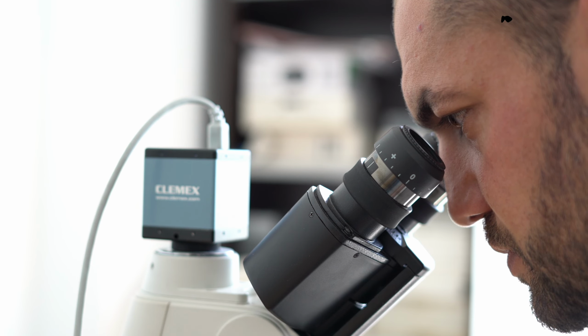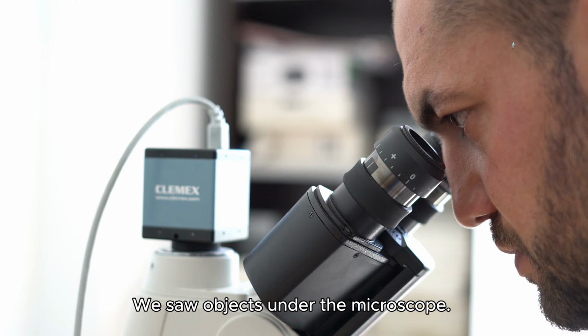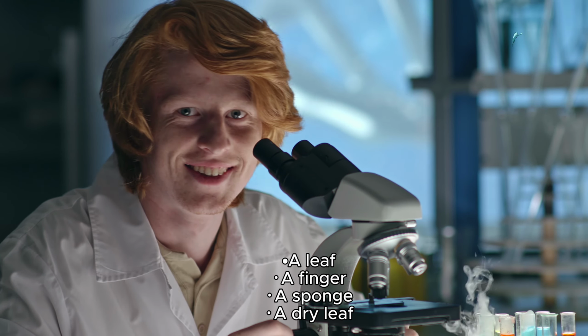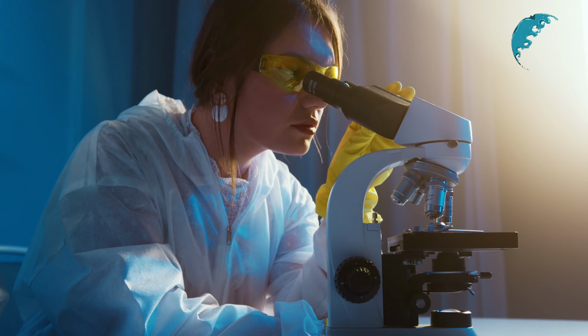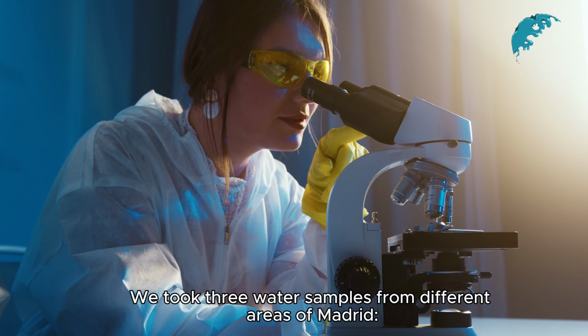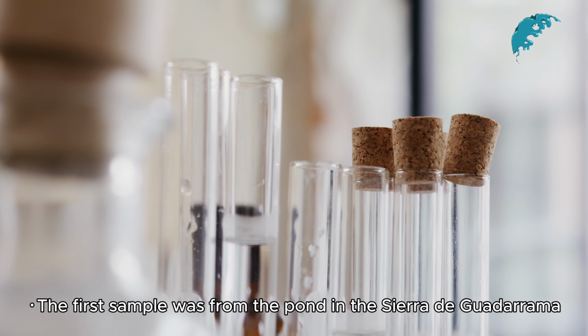Methods of research. We learned how to use microscopes. We saw objects under the microscope: a leaf, a finger, a sponge, a dry leaf. We took 3 water samples from different areas of Madrid. The first sample was from the pond in the Sierra de Guadarrama.